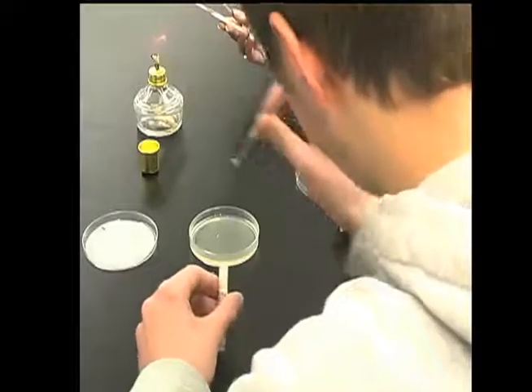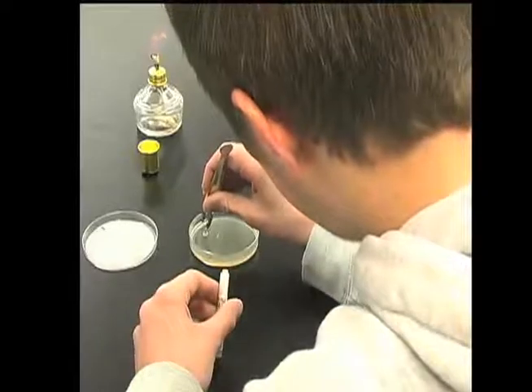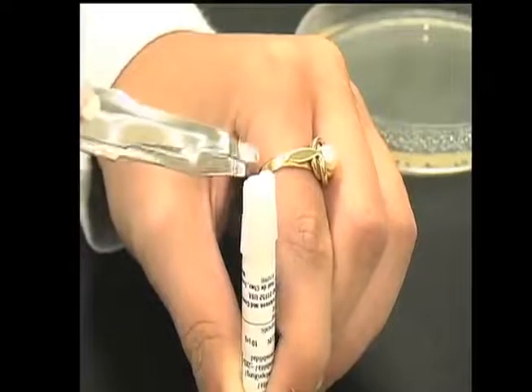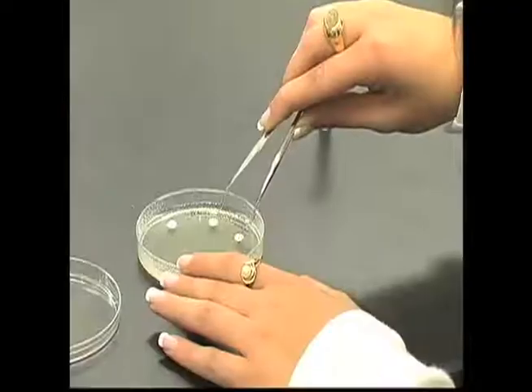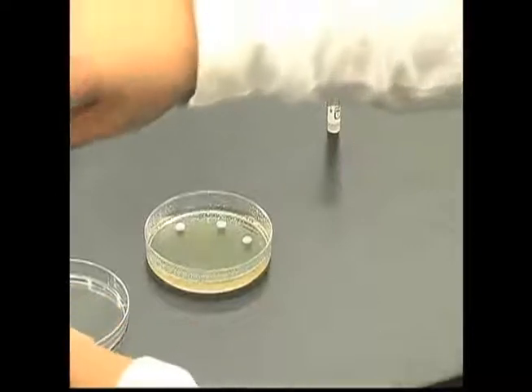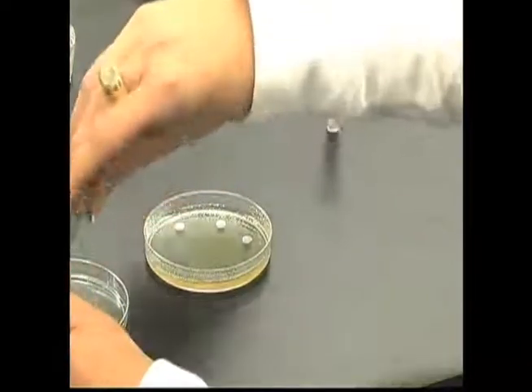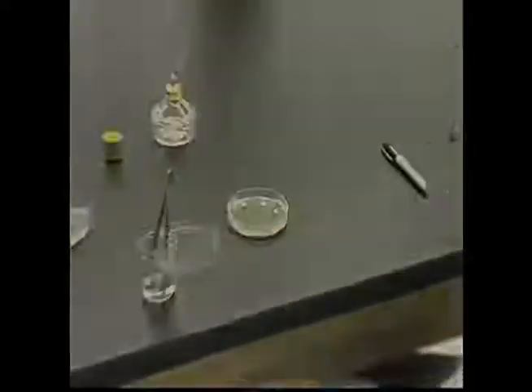This activity shows students working with two different bacterial strains to measure the effectiveness of different antibiotics in controlling the growth of these bacterial strains. Bacterial isolates are spread across an agar plate and paper discs containing antibiotics are placed on the surface to determine if the bacterial strains are sensitive or resistant to the particular antibiotic studied.